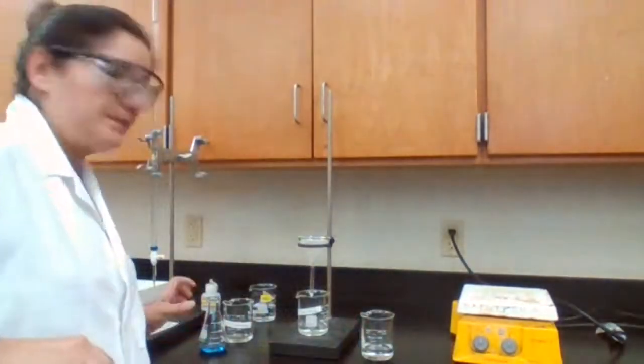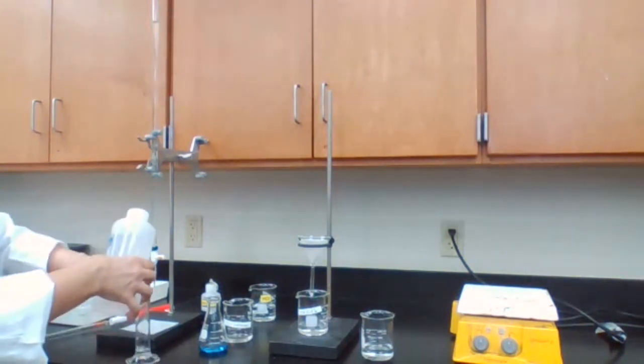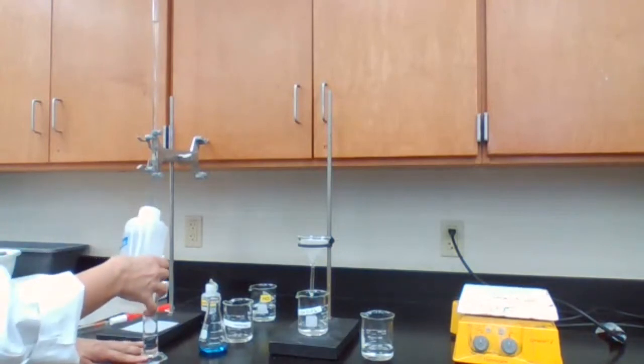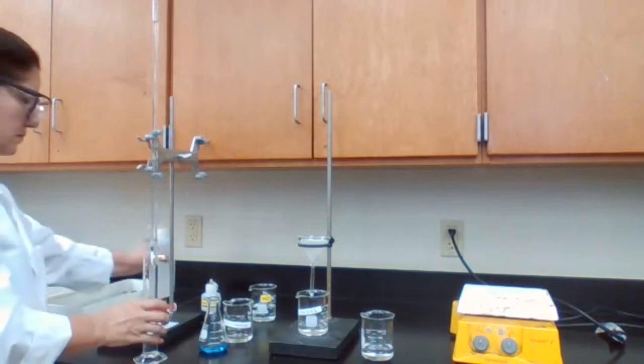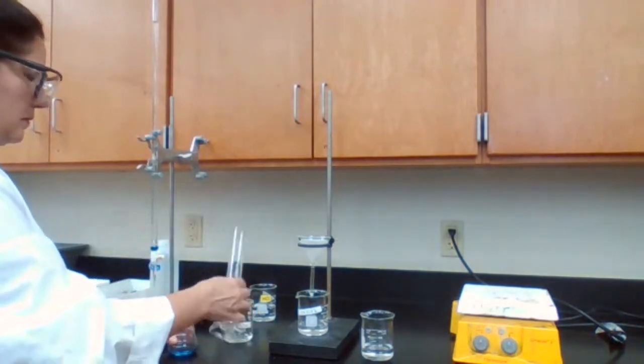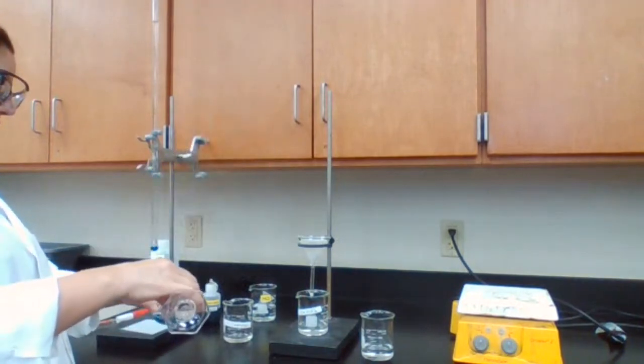Okay, so I just need to add 25 milliliters of distilled water. Okay, 25 milliliters of distilled water.